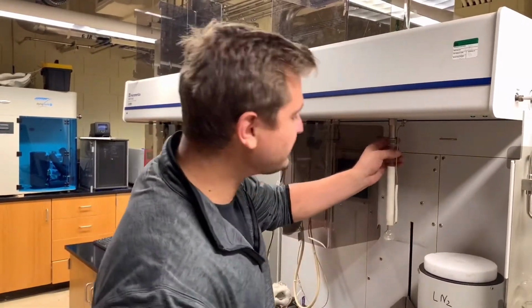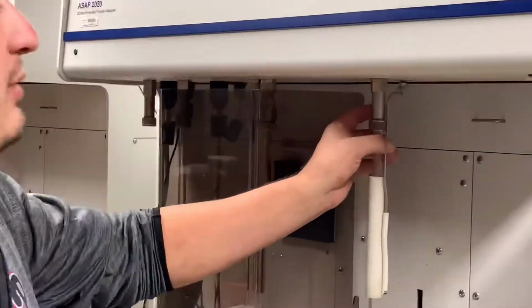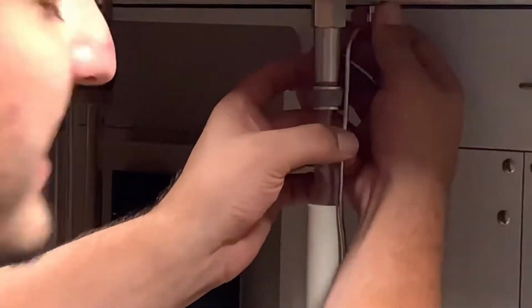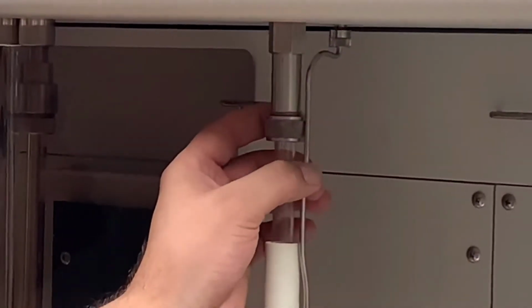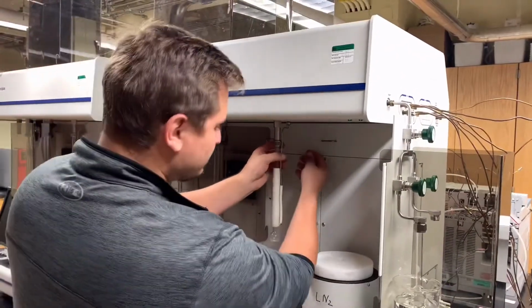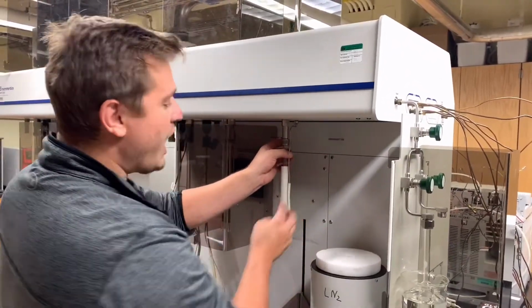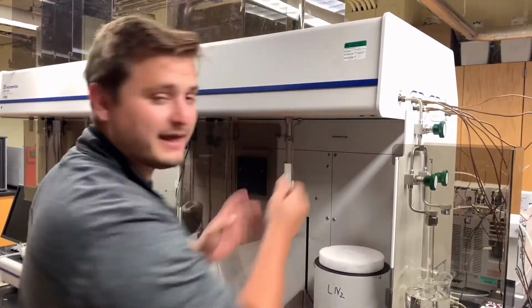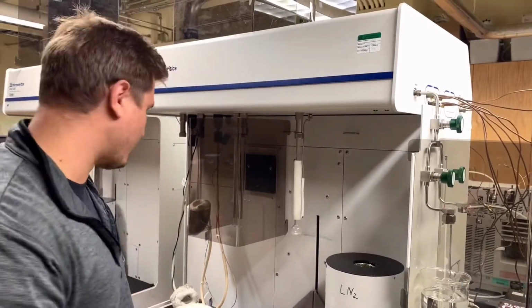So we want to make sure that this tube is carefully placed as close to the sample tube as possible. Back here, there's a little screw. You want to make sure that that is screwed tight. Righty-tighty, lefty-loosey. So we will, again, hug this P0 tube as close to our sample tube as possible while tightening that sample tube. We will prepare our temperature bath, or our liquid bath.